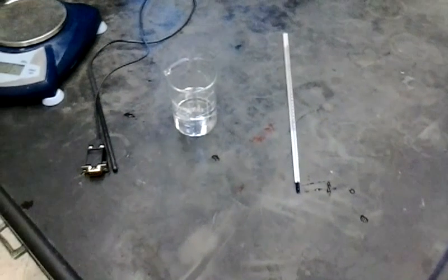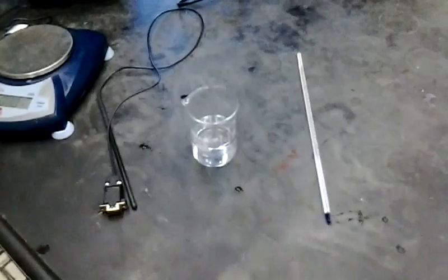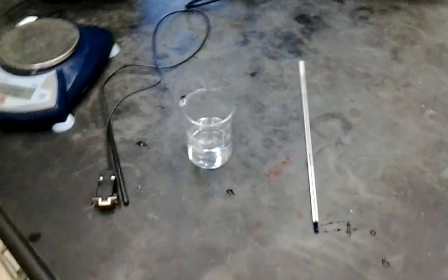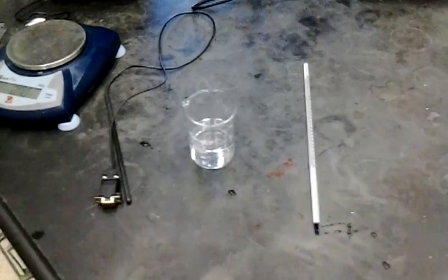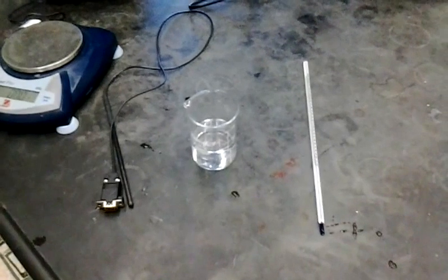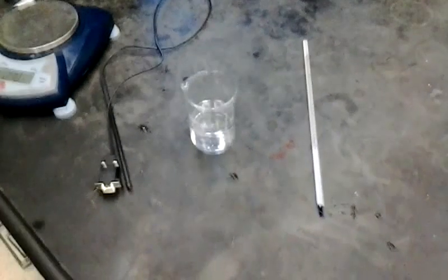Okay, today we're going to learn about how to use the temperature probe and how to calibrate the temperature probe for the MeasureNet system.